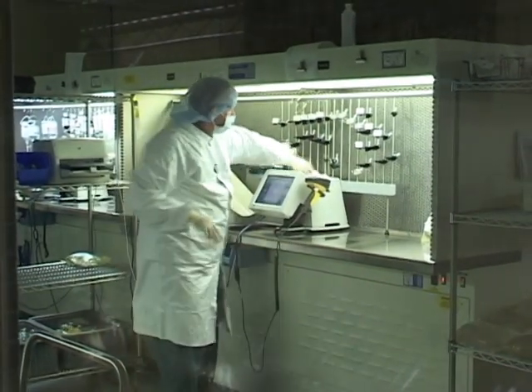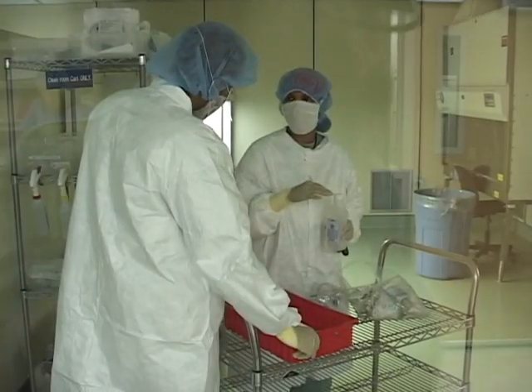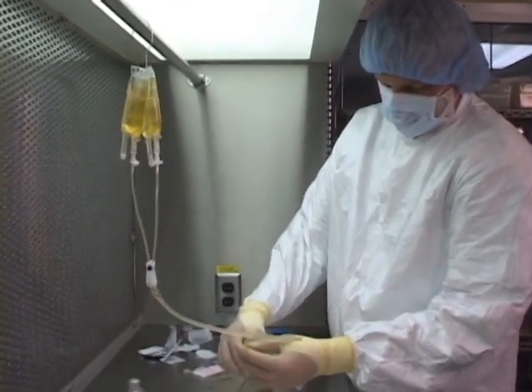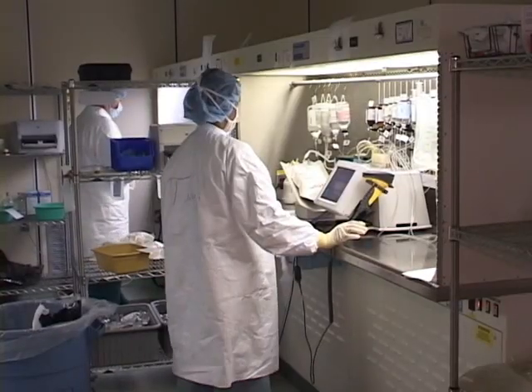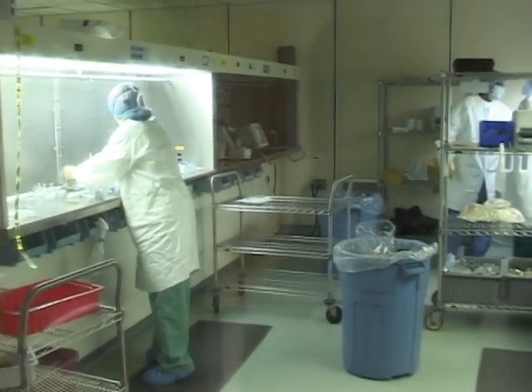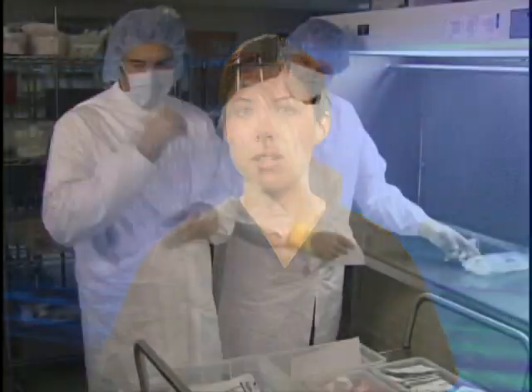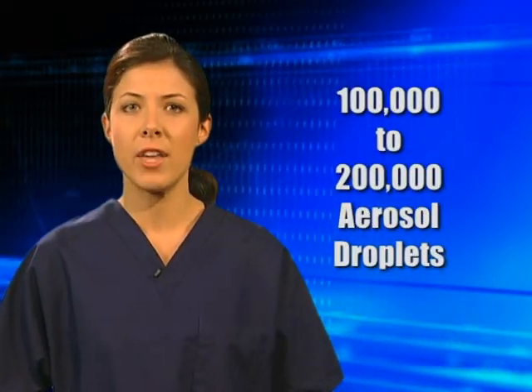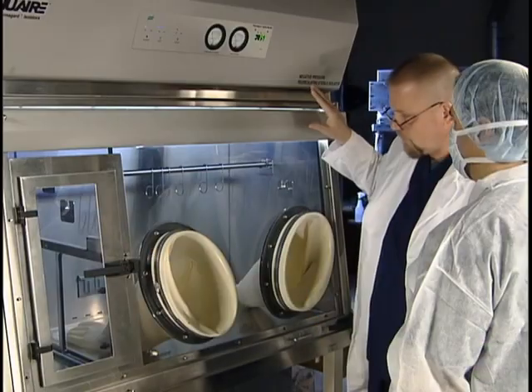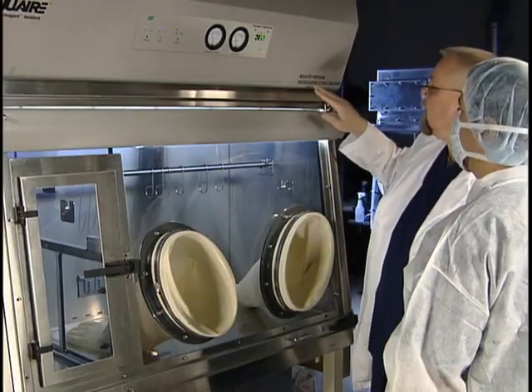A clean room, or buffer room in basic terms, is the room that houses the primary engineering controls where the aseptic compounding work is done. The clean room is a specially constructed enclosed area containing one or more clean zones, where the concentration of airborne particles is strictly controlled. Did you know that standard room air typically contains hundreds of thousands of suspended particles per cubic foot? Particles such as dust, pollen, smoke, and bacteria? Sneezing, for example, produces 100,000 to 200,000 aerosol droplets that can then attach to dust particles. Therefore, the control of airborne particles is important.